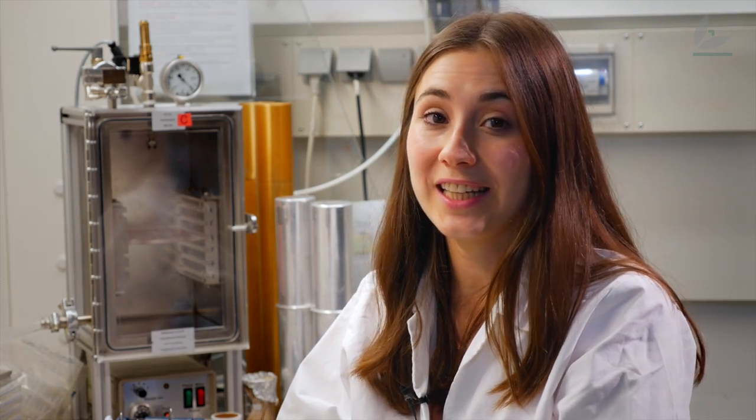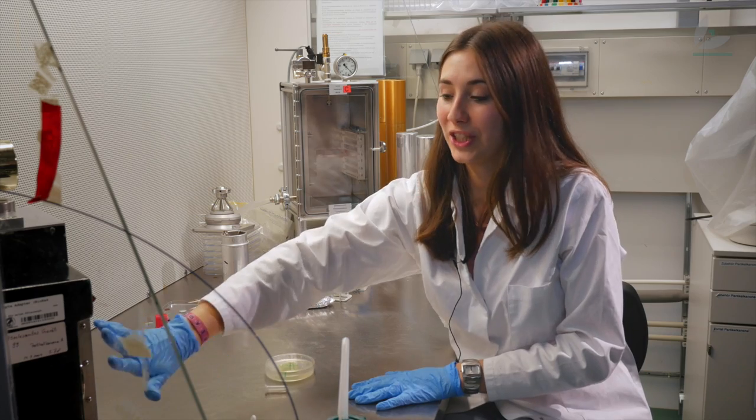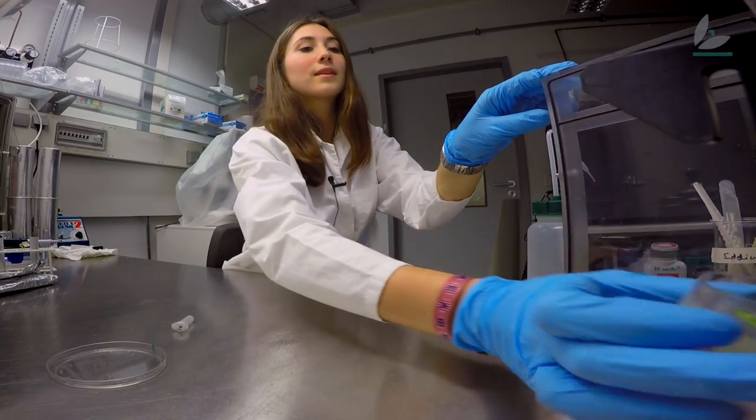In order to do so, I need a gene gun. Here I have my gene mixed with gold particles. The gold particles are important to efficiently shoot the gene inside of the leaf piece. I have already loaded my gene inside of the machine and now I'm going to introduce the leaf piece. The gold particles are shot inside of the leaf with very high pressure, just like an air rifle.